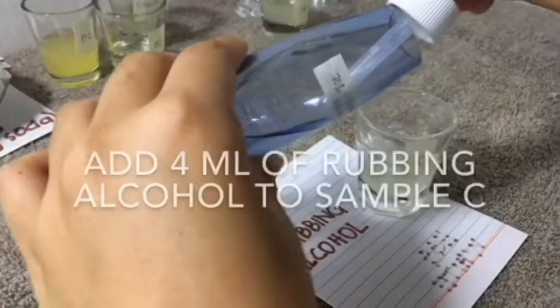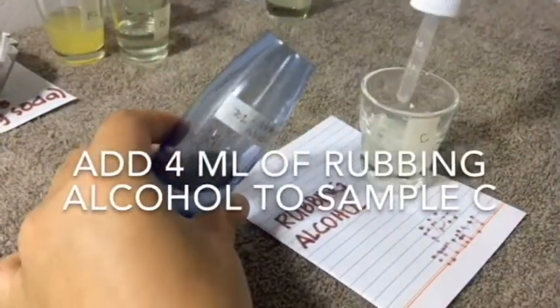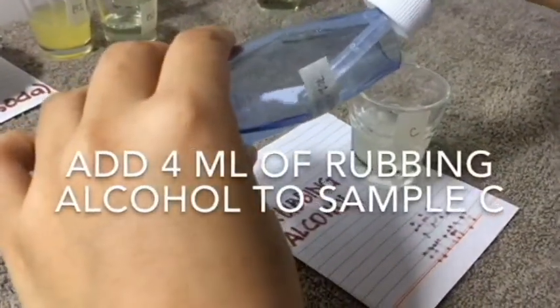Solvents such as alcohol are capable of forming hydrogen bonds with protein molecules, which will disrupt the hydrogen bonding within the molecule.